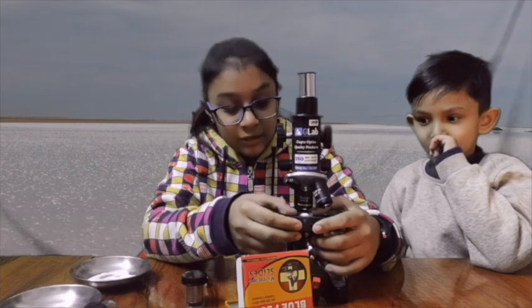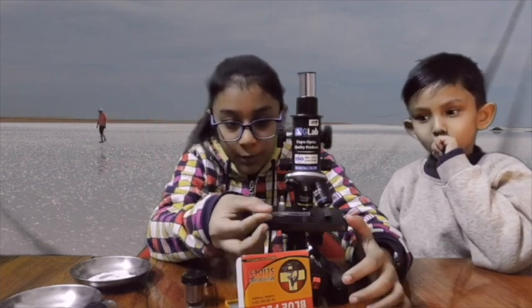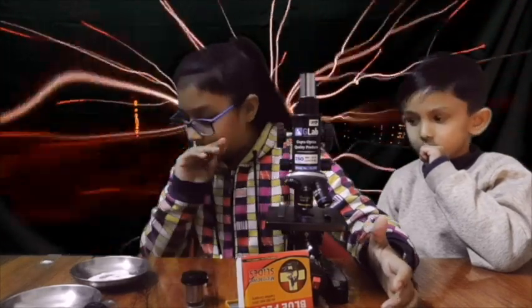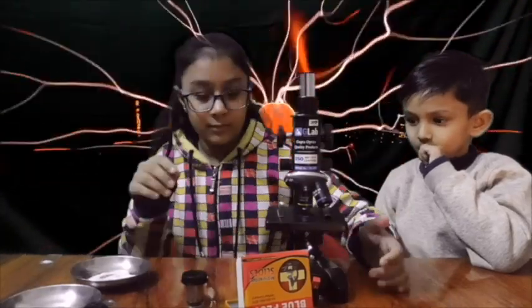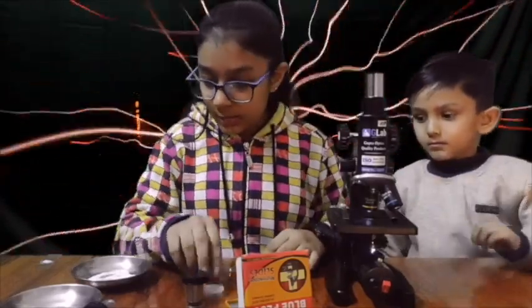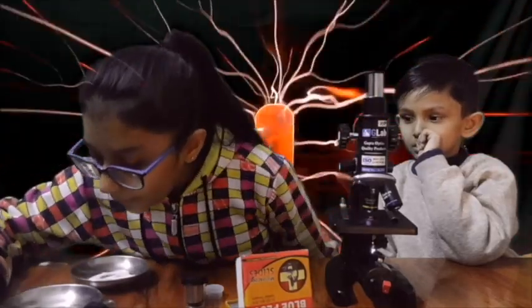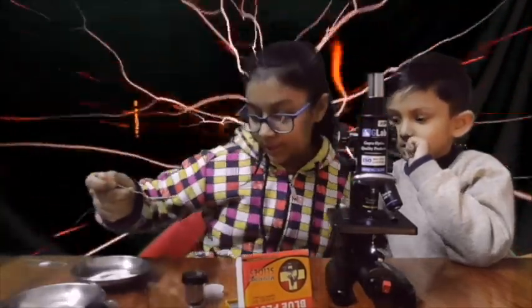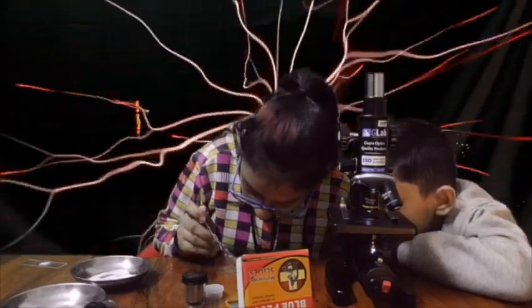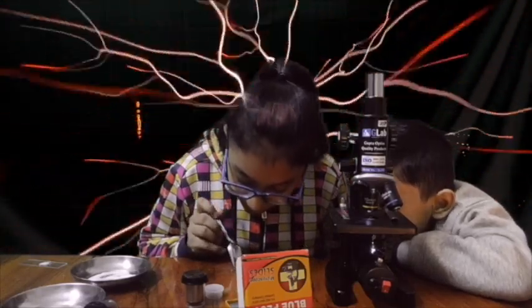Now it's time for the second item. Let's just remove this. We're gonna put this slide here. Okay here it is. I'm gonna use the next item which is black salt. It is not really black though.